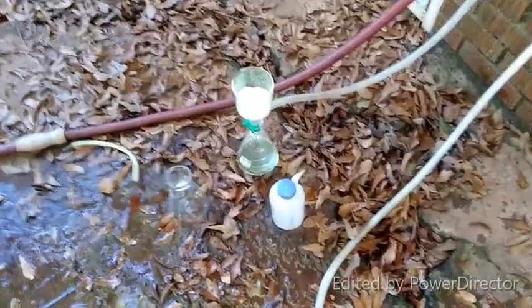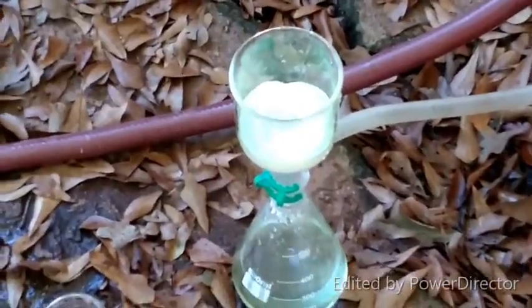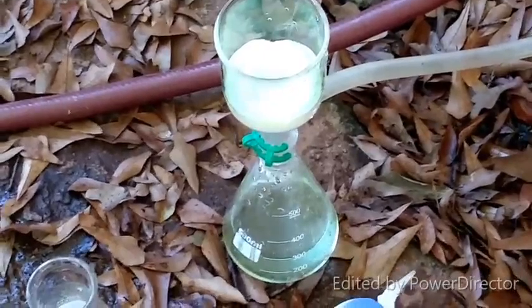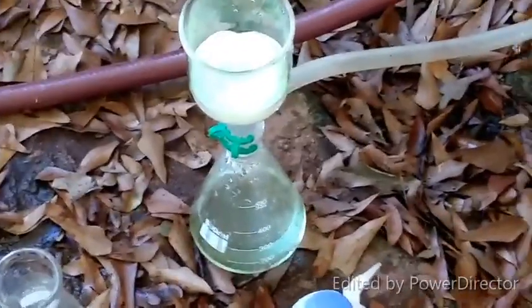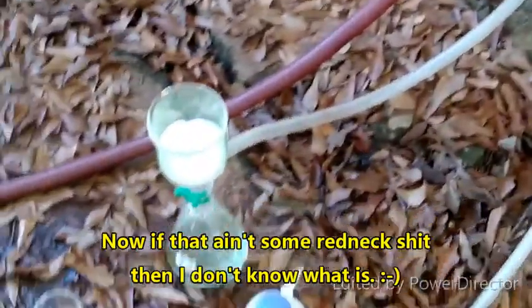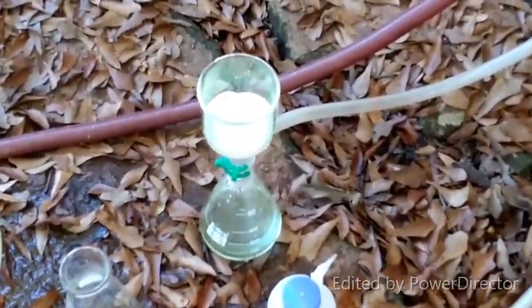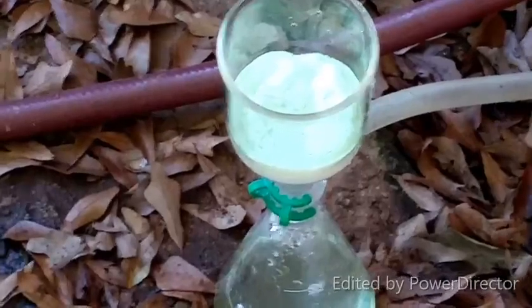Here at the Poor Man's Chemist, we improvise and do the best we can with what we've got. We have an aspirator running off a garden hose — but you know what? It works. Although it's a real pain when you want to pump something down and keep it dry. I would really love to get a vacuum pump.